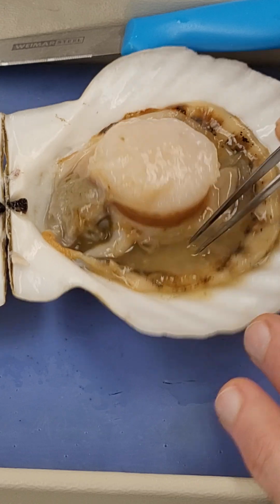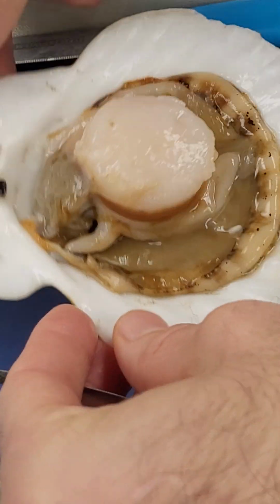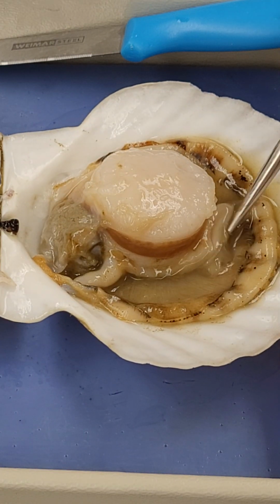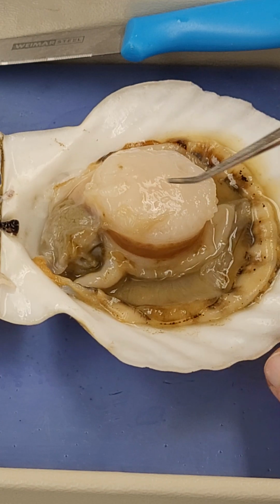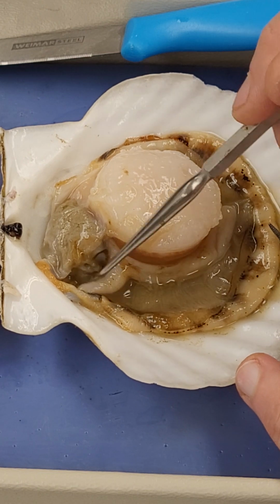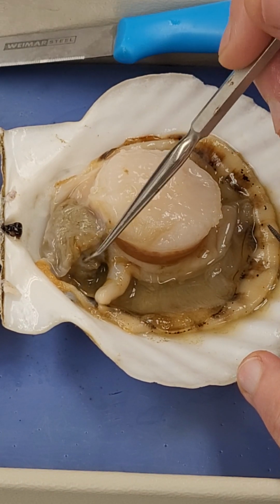Ctenidia, I'm just going to see if I can lift one up from inside this fluid. Let's pour that fluid away. That's going to make life easier. There we go. So if I lift up the ctenidia, that's this structure here. There'll be another one over the top like this. That's where food capture occurs, and food is passed around to the labial palps, which are this structure just here, and into the mouth.